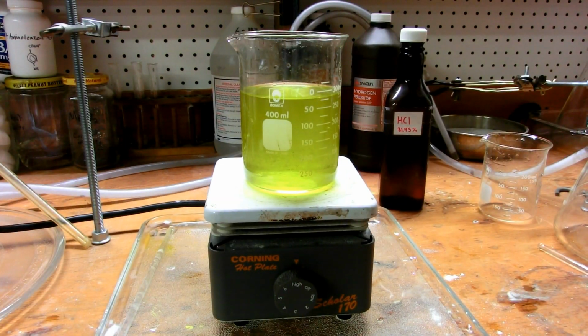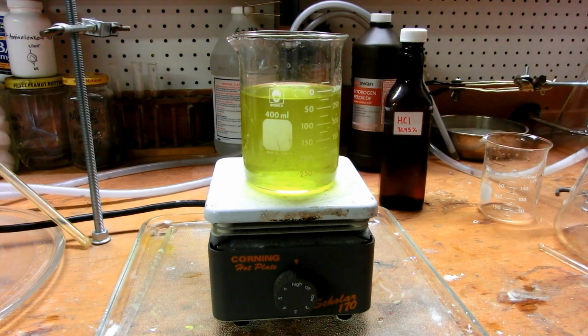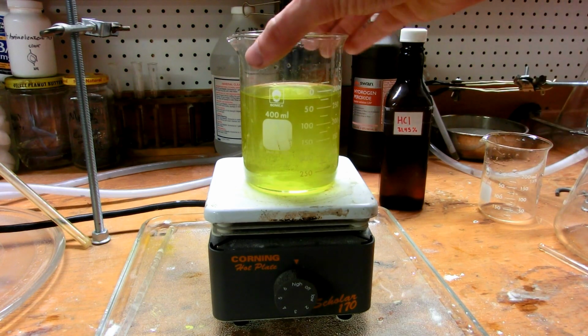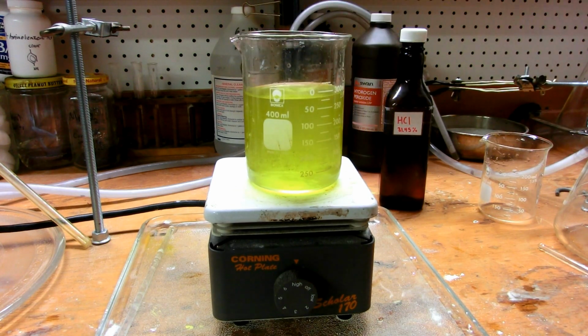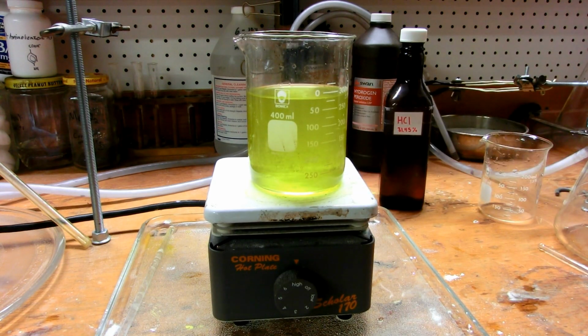Okay, so here's an update. You'll notice that upon heating, the solution is gradually getting cloudier. You see, you almost can't see my hand through it anymore. And I'm thinking that maybe the reaction isn't as spontaneous as I once thought, and that even just a little bit of heating will precipitate our iron oxalate. And as you can see, water is starting to boil off the hot plate underneath. So it's warming up. It's maybe 40 Celsius at this point.